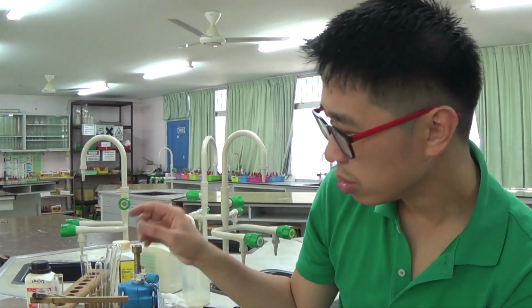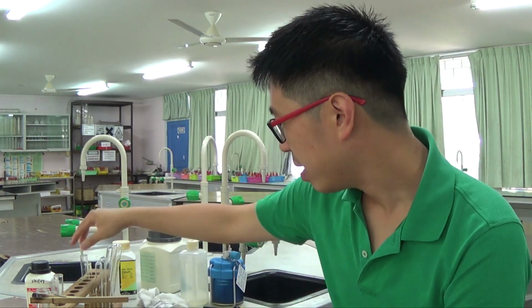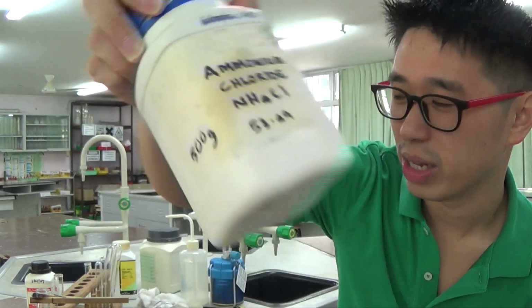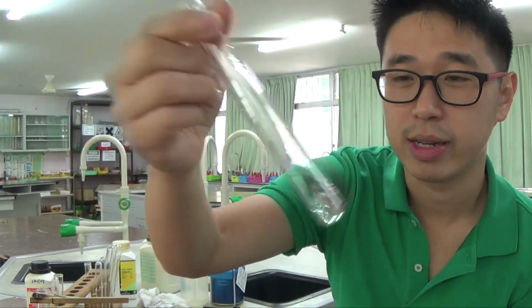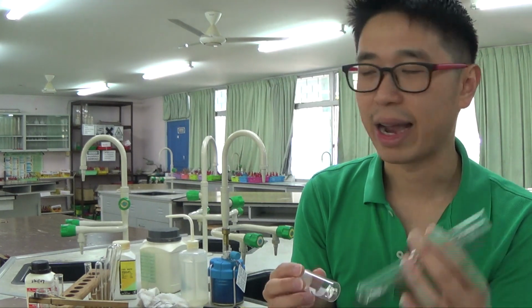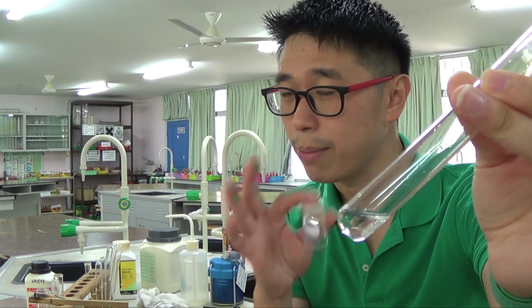Okay? So the second last thing, remember I made up a solution of ammonium chloride as well. I was going to show you the difference between ammonium chloride and ammonium nitrate. Ammonium chloride would definitely give you the ammonium ion test, but I just want to show you that when I add aluminium foil, now I can't show you that, because if I test for nitrate, this is ammonium chloride, yeah?